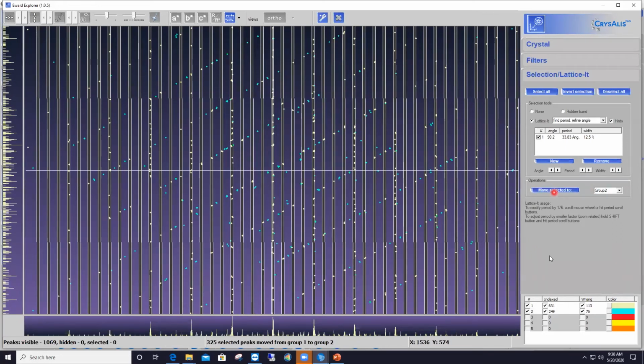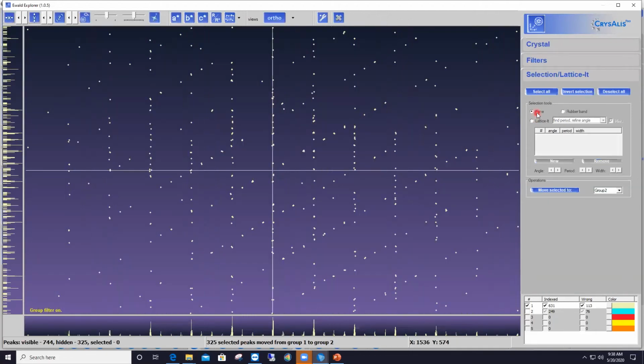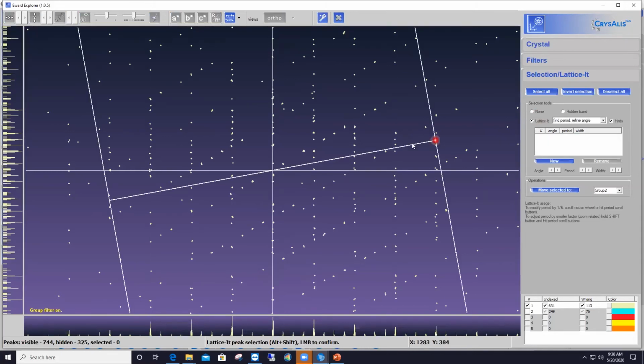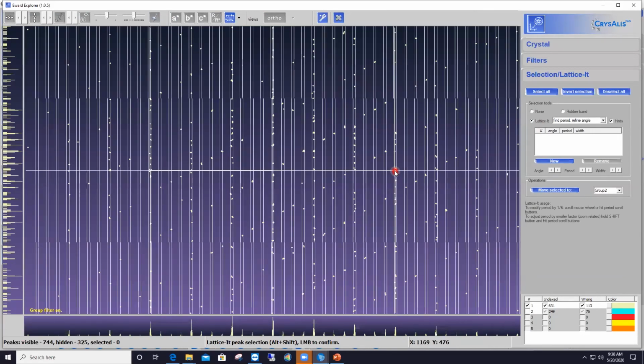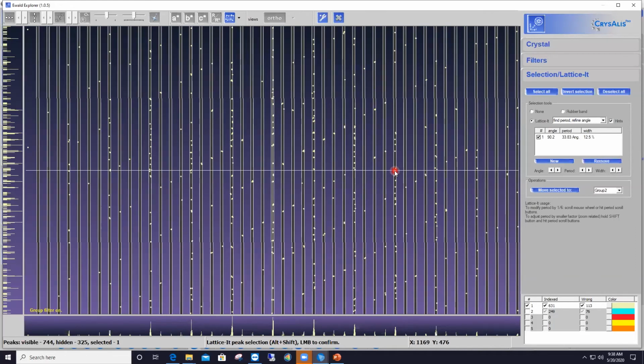Let's see what we've got so far. I'm removing group number 2 from the display by unchecking the corresponding box here, and I disable the Lattice-It feature. So here we kept our vertical rows, but we still have reflections from the oblique rows. So why is that? All right, so let me do it again. I'm re-enabling the Lattice-It feature here and aligning my cursor again along the vertical rows and freezing the view.